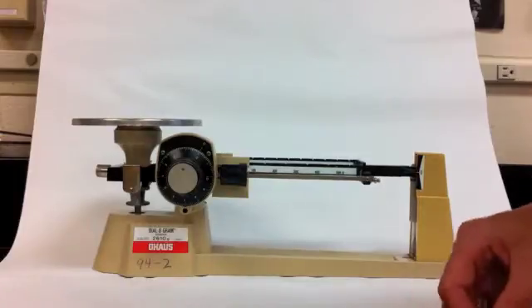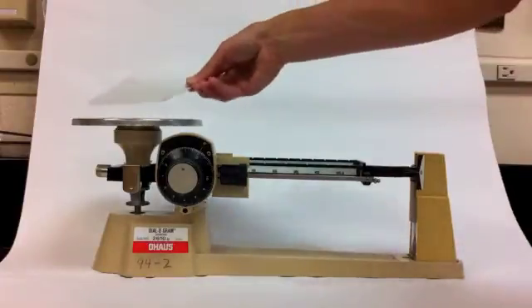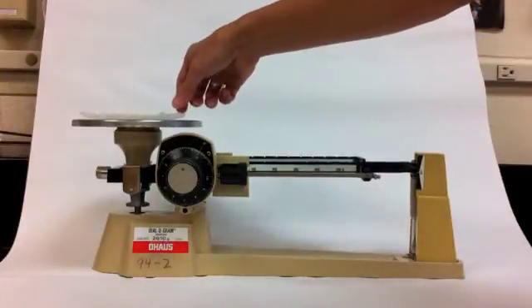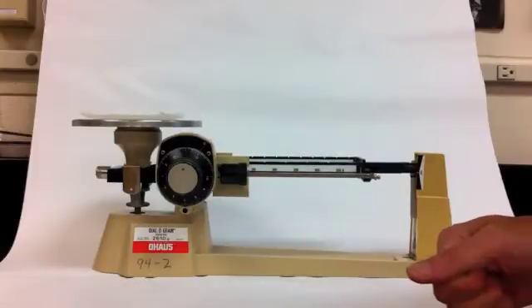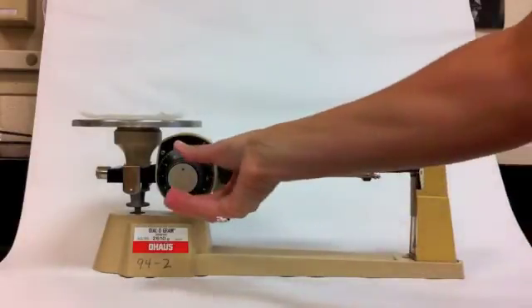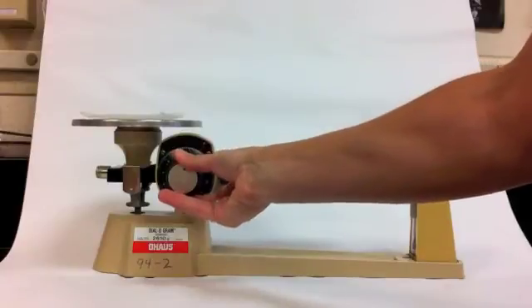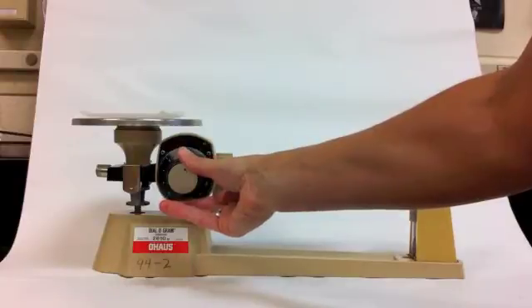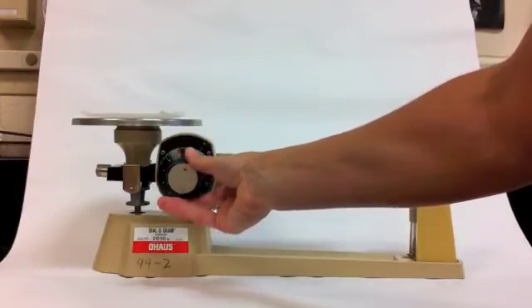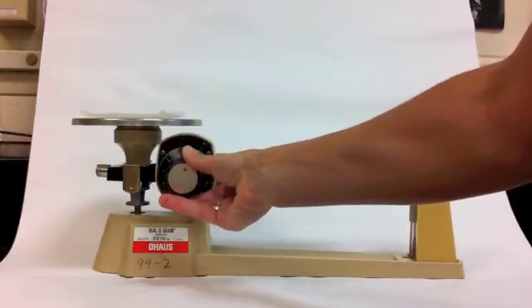Now that the balance is zeroed, you may put your piece of weighing paper or weighing boat on the balance pan. But before you put the chemical on, you need to find the mass of the weighing paper. So I'm going to dial my dial just a little bit. Now it's at zero.